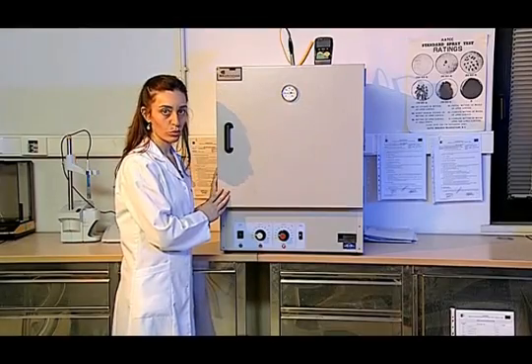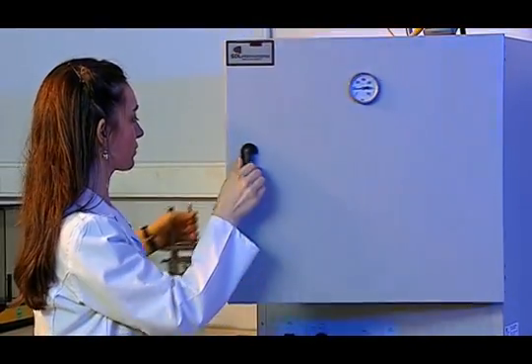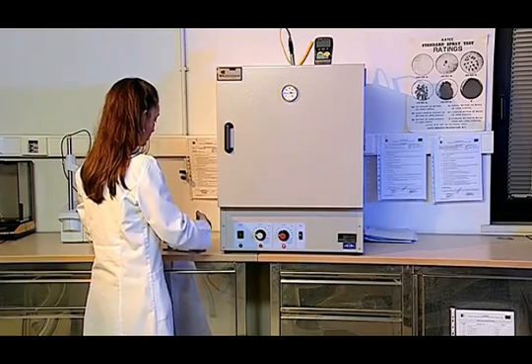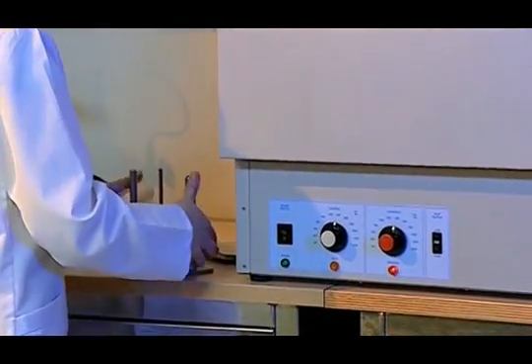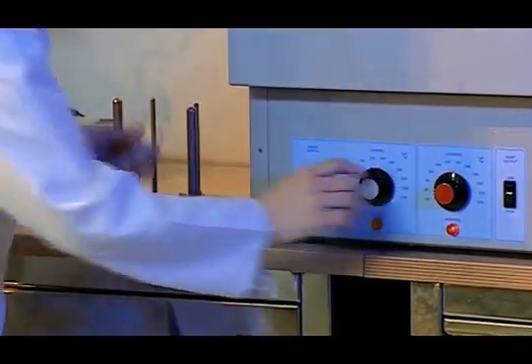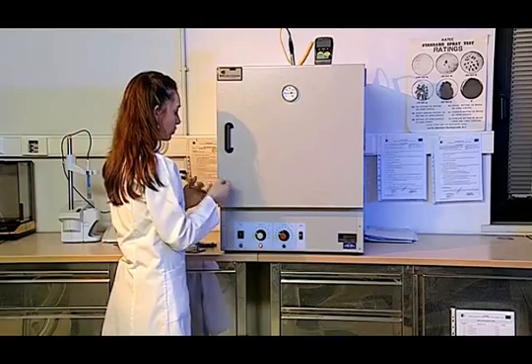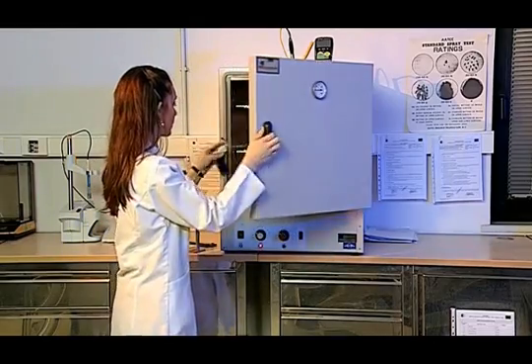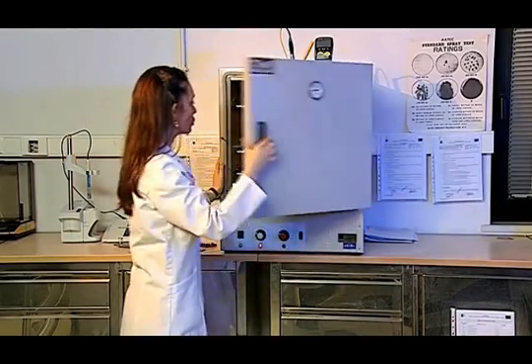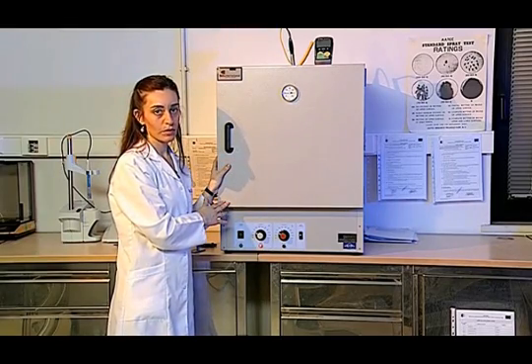The sample is removed from the oven after 4 hours. I remove the sample from the oven and the oven is adjusted not to exceed 60 degrees centigrade. I hang the sample along the short edge. After the sample has dried, the test is finished, to determine the staining and the discoloration.